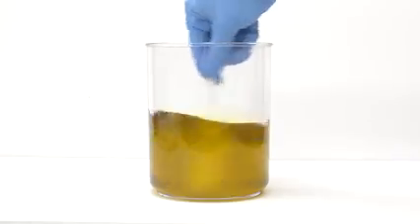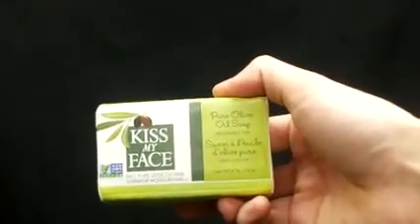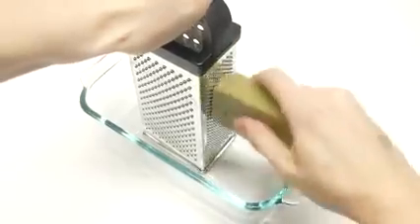Also, most commercial soaps are a mixture or have a lot of additives. With a little research though, I managed to find a bar of soap that claims to be made from pure olive oil. It also says that it has no additives, colorants, or anything, so it seems to be ideal for my purpose. Okay, to start things off, I need to grind up the soap.